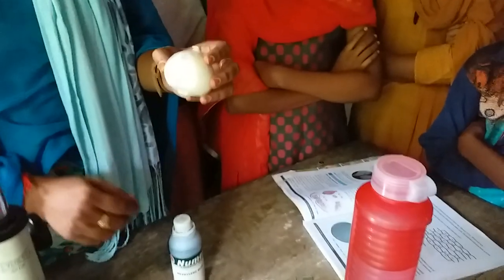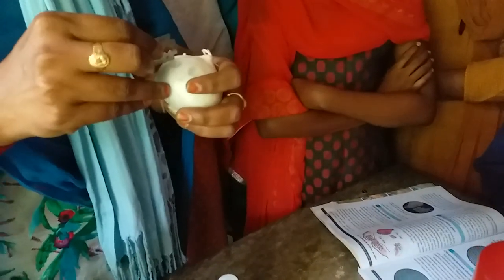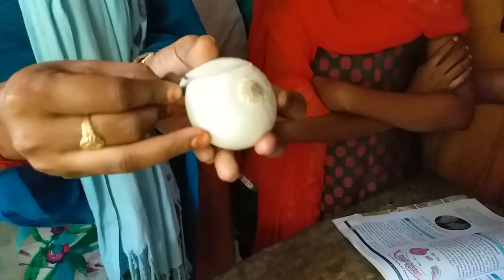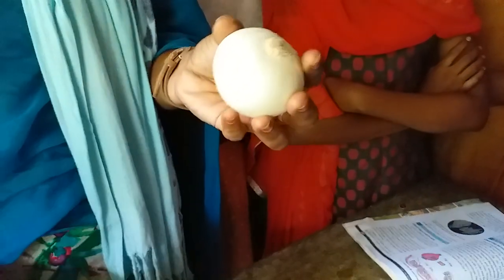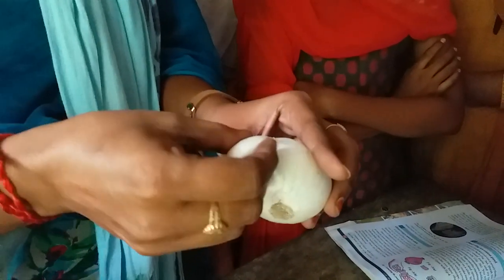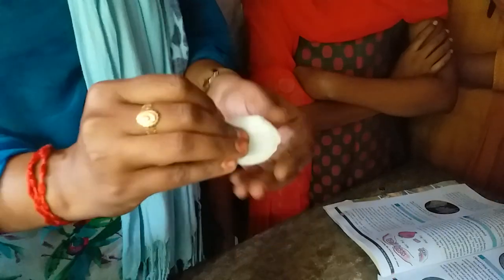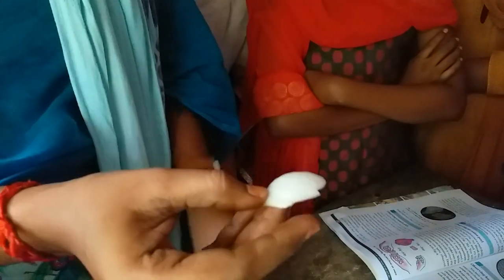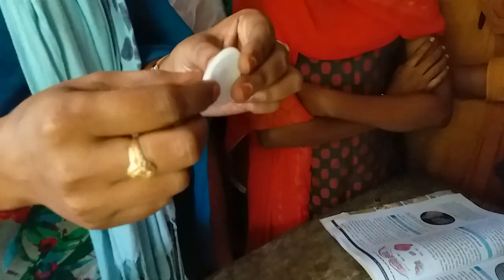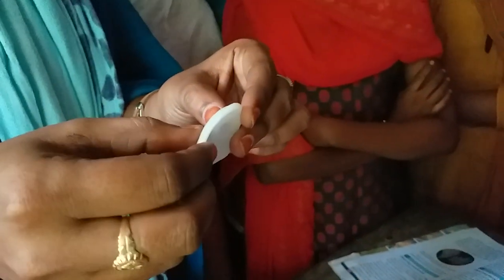For that we need an onion bulb. First we have to take a fleshy part from this onion bulb. We have to break this fleshy part into two parts.